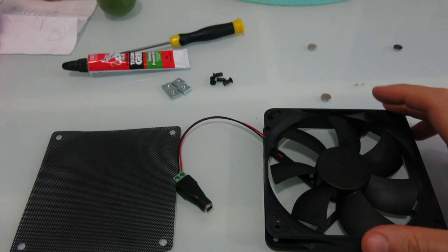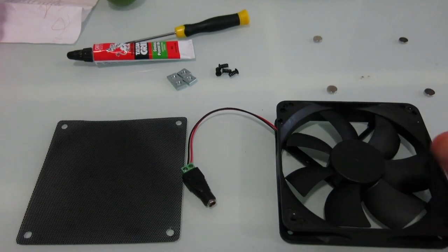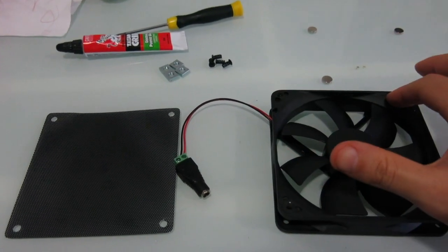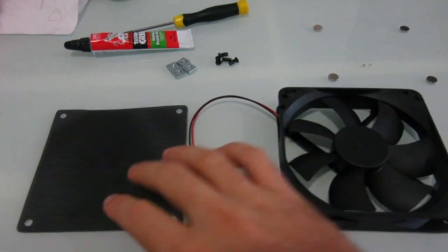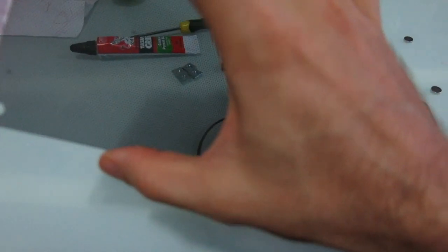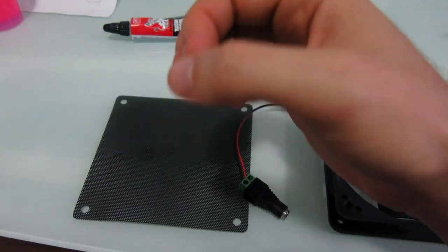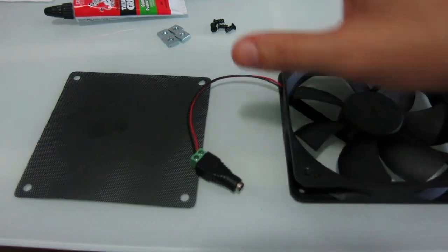So this is a computer hard drive fan. It's the biggest one I could get. I think it's 12 centimeters by 12 centimeters, biggest one I could get. And I also got a screen cover, so then that way I can put my Erlenmeyer flask for my yeast starter on top.